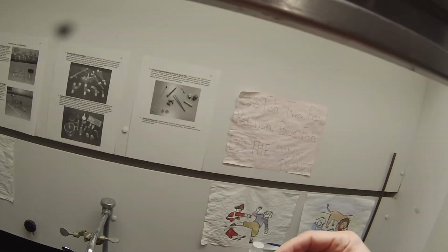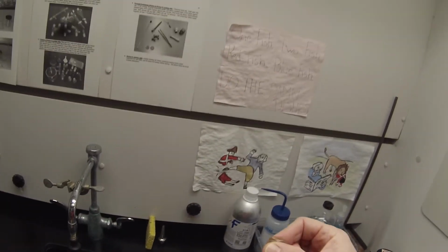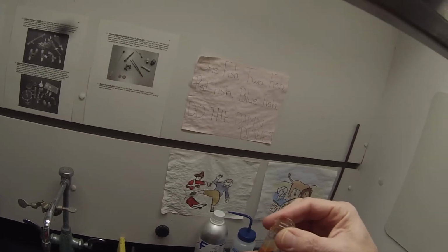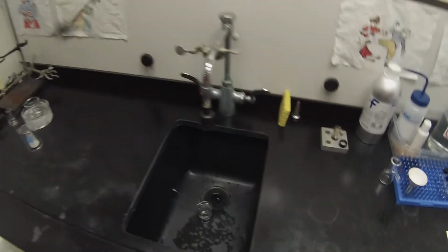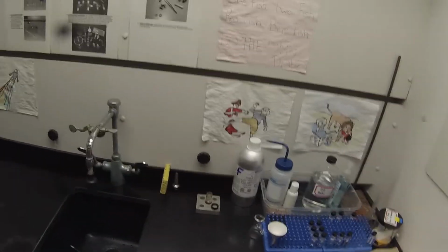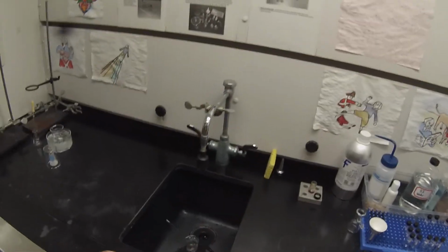So that's all there was, one seed crystal. Very small one, right? Because I don't want to contaminate it too much. And I don't think the solid is going to be the same. So we'll let that sit, let some of that ether evaporate, and we'll see where that gets us. And then if that doesn't work, we'll do something else.